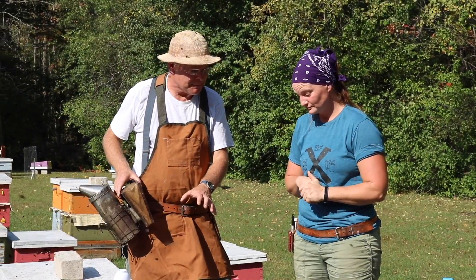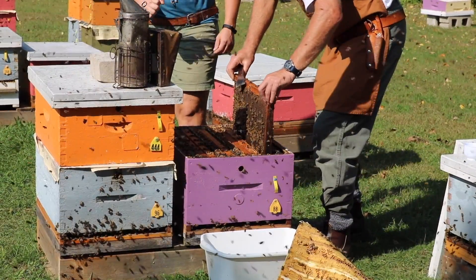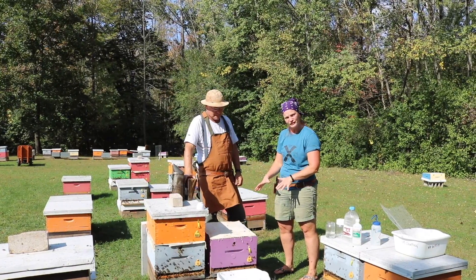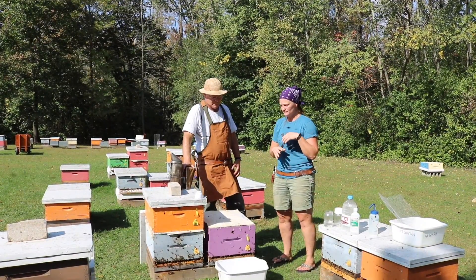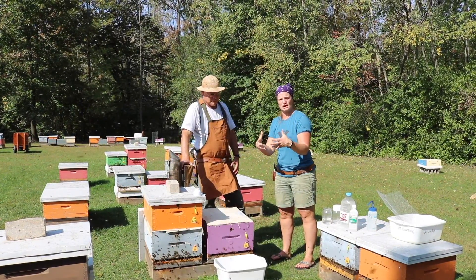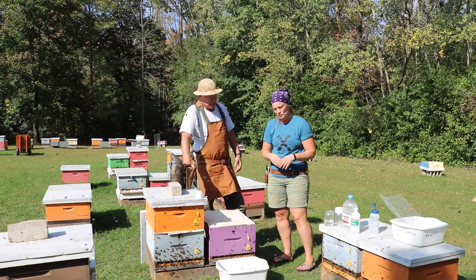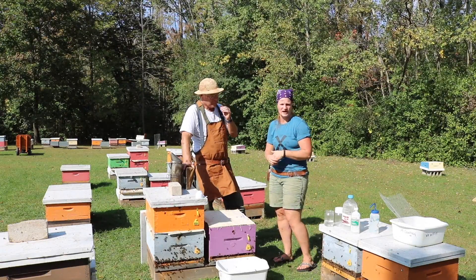To take this sample, what kind of bees are you looking for? We're looking for bees from the brood chamber. The varroa mites live within the brood so that's where they will stay — they typically hang out on nurse bees and house bees. We want to make sure we're down in the brood chamber. Find the brood frames, frames with brood on them. A variety of brood is good — you want some open larvae and some capped brood because the mites are attracted to that open area, but the house bees are looking after capped brood as well. We also say you shake a variety of frames into a tub so that you're not just relying on one frame for that sample.